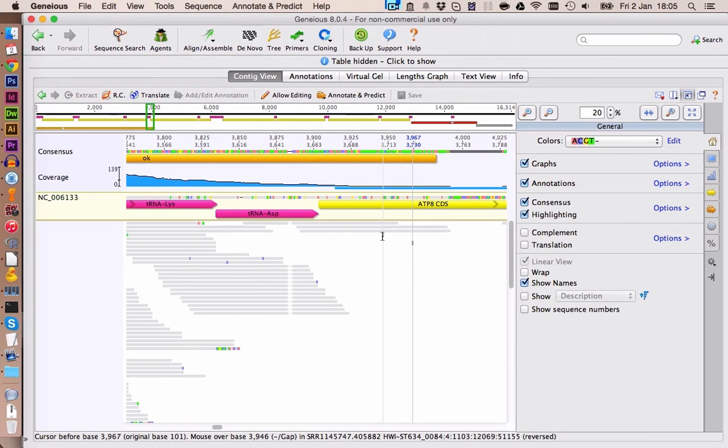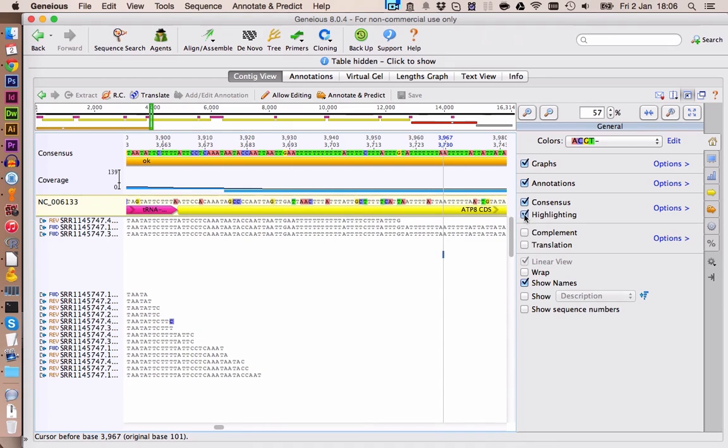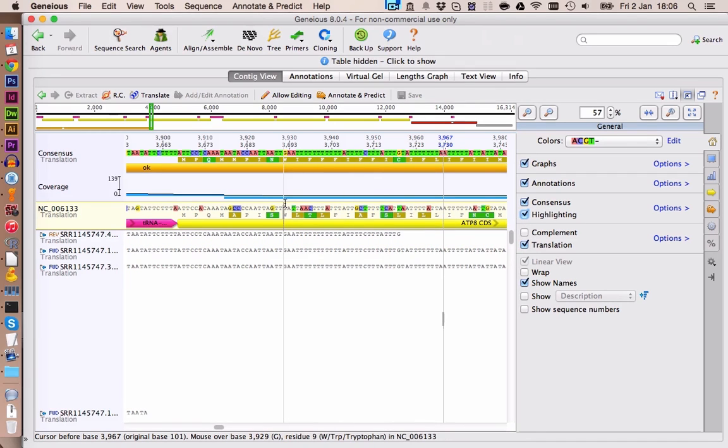The sequences for ATP8 could be interesting, because if we take a closer look in here, we see, if we disable highlighting, that we have quite a lot of T's in our sequences. So they match quite well here, but this kind of looks suspicious. So as this is coding, we can just run a translation. And you can see here, let's turn on highlighting again, that this isn't very closely matching. So those sequences down here might not be very reliable.